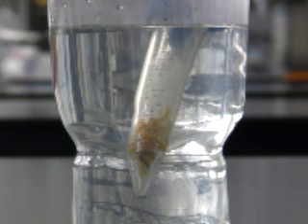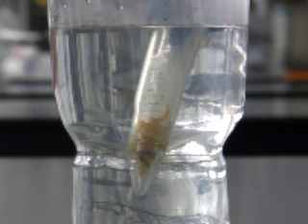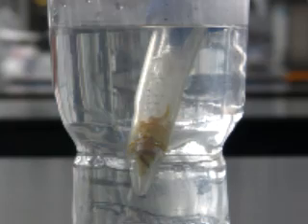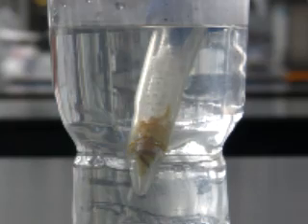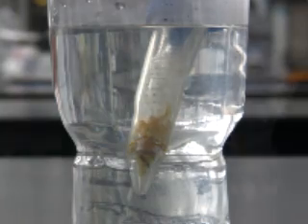Here you can see the liquid carbon dioxide percolating through the orange peel, and as it does so, it extracts the compound limonene. Here you can see the liquid carbon dioxide boiling both above and below the orange peel, and at the bottom of the tube you can see evidence of limonene, which is a pale yellow oil.